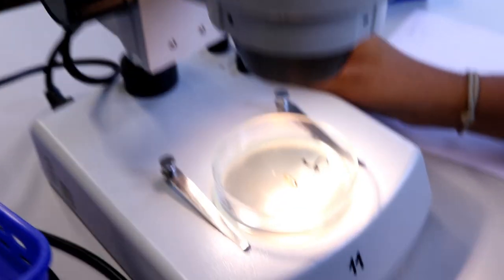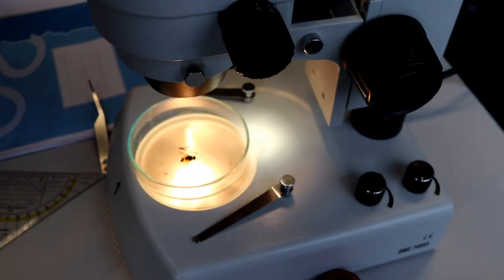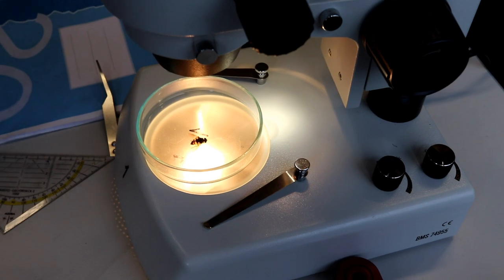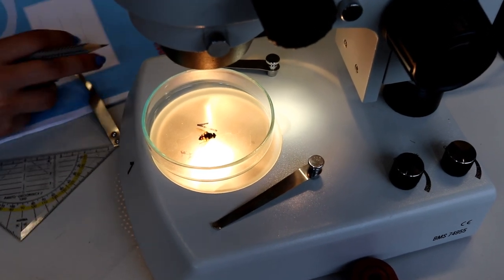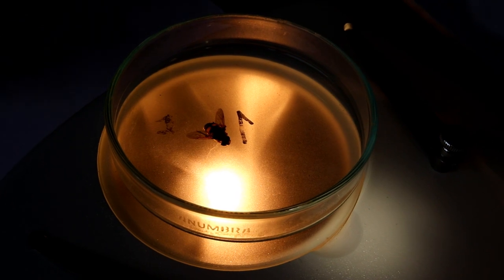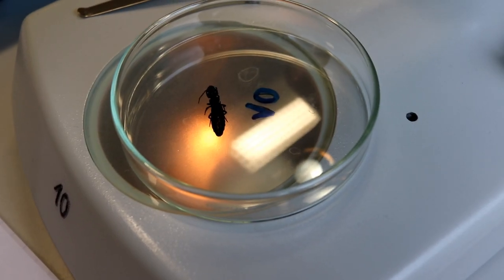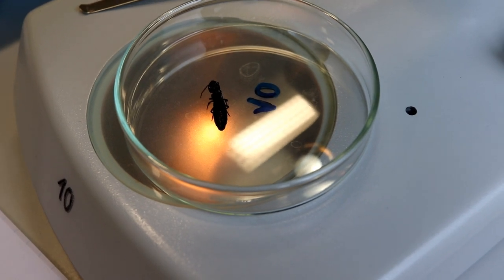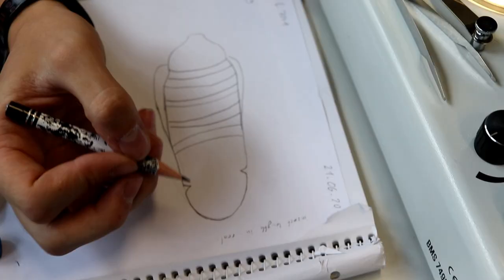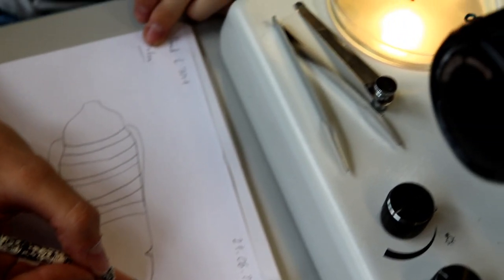Students had to identify the insect using an identification book that we have, and they also had to draw it. This is one of the few biology labs where we don't end up mixing chemicals because students are very much in close contact with nature. The feedback we've gotten from students in previous years — we've been doing this for many years — is that many students actually lost their fear of insects, and it shows them that it's important to value those life forms as well.